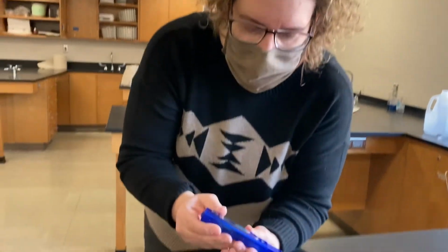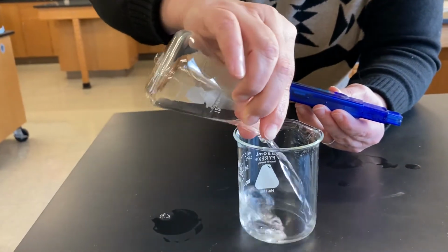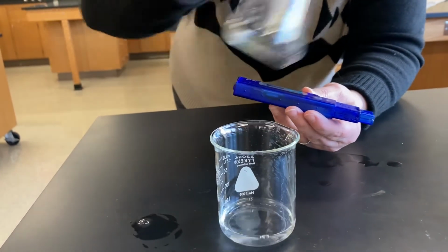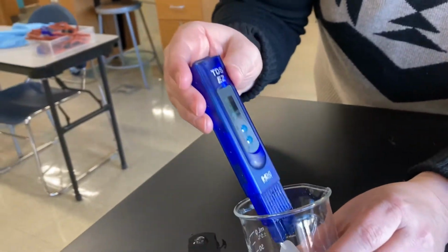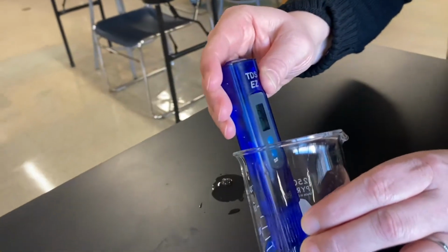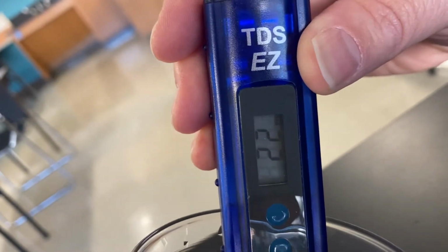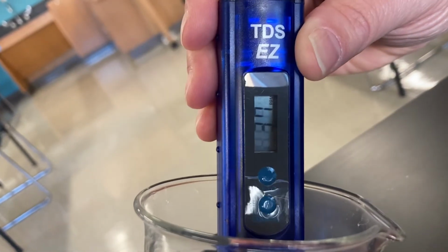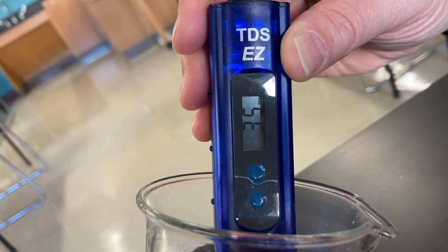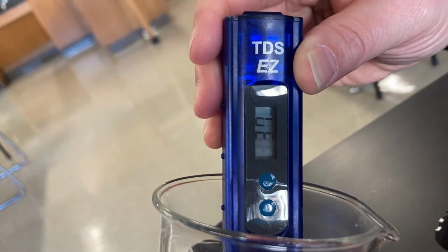Okay, perfect. So now, this is our collected water. Let's see what happened. I'm going to tilt the beaker just a little bit so I have enough depth. Oh my gosh, Mrs. Von Eschen, can you get close on that? It was in the upper 30s. Whoops, sorry, it's jumping around a little bit here. I'm seeing like 37, 35. 35 seems to be where it's settling. Yeah. Let's call it 35.